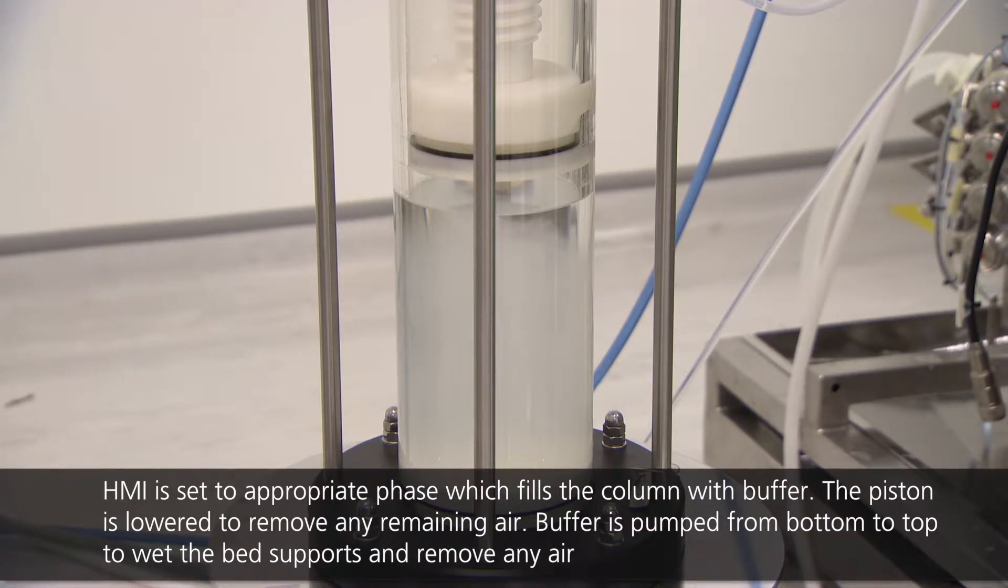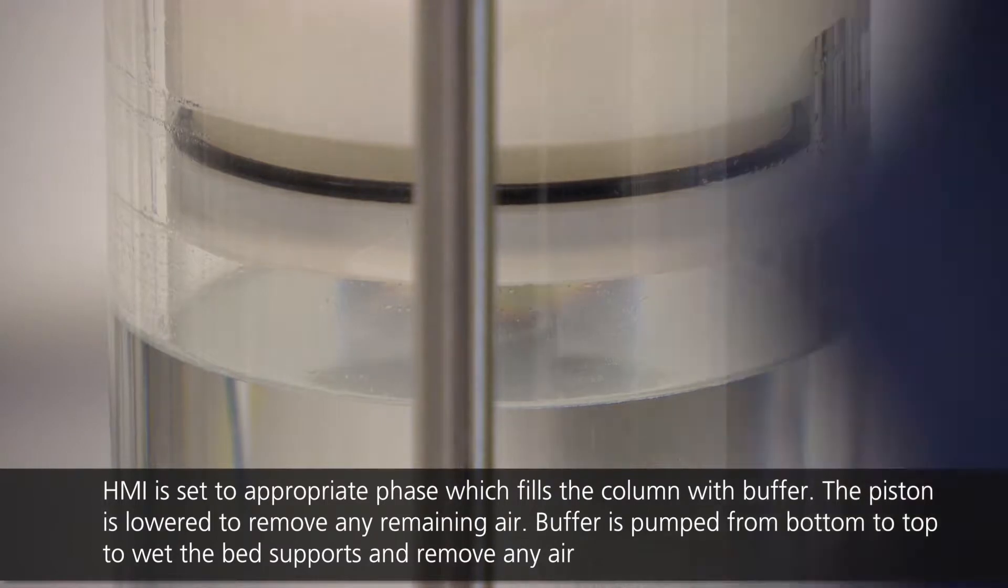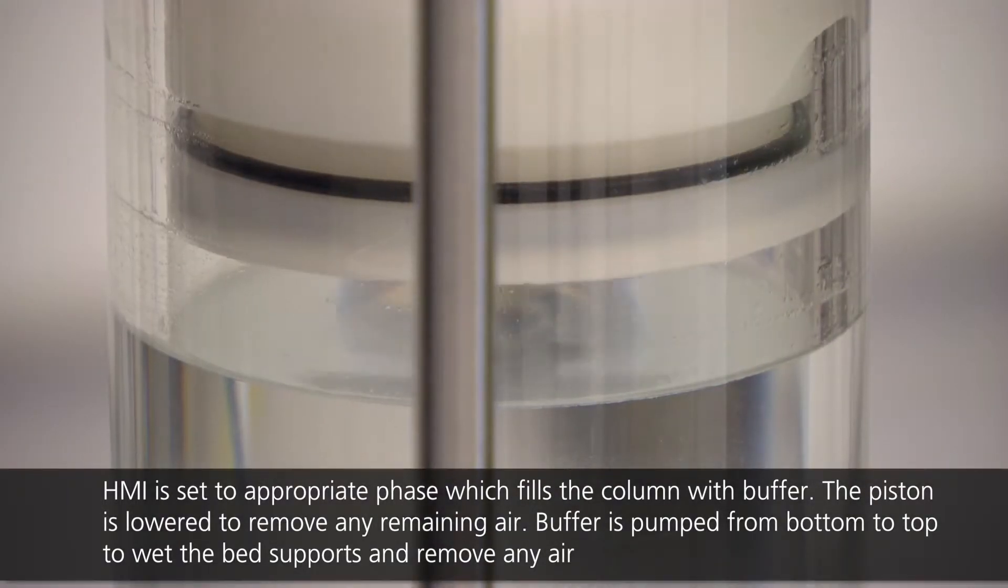As the column fills, some resin bound to the surface of the bed support may become resuspended, which increases the opacity of the buffer.